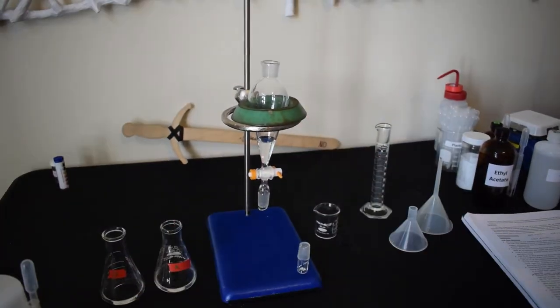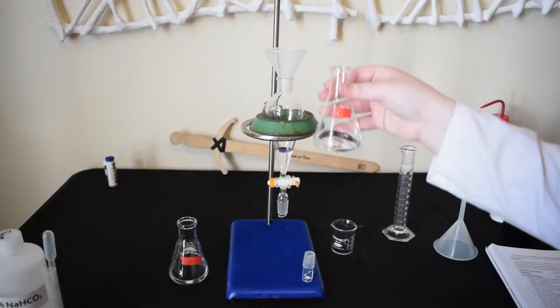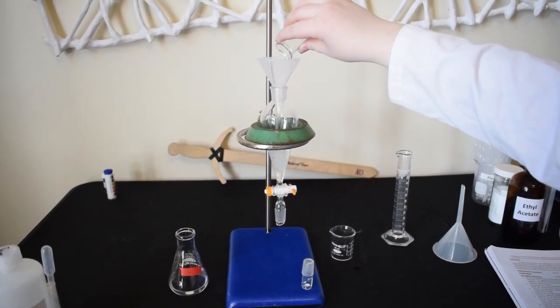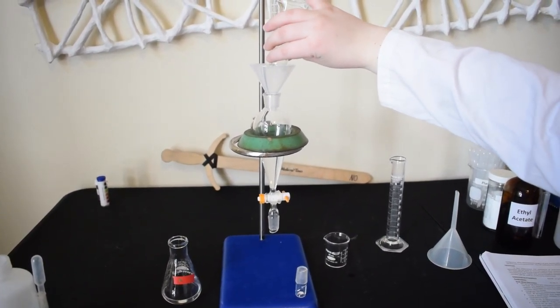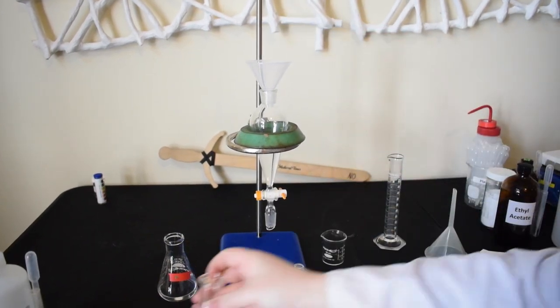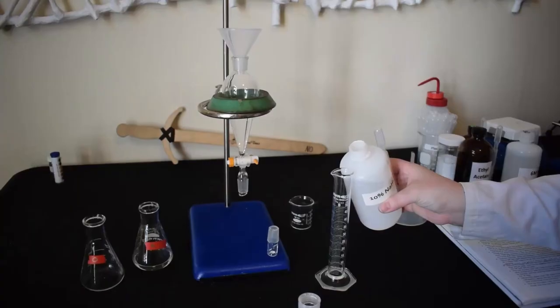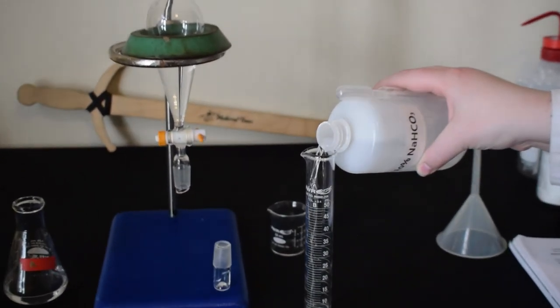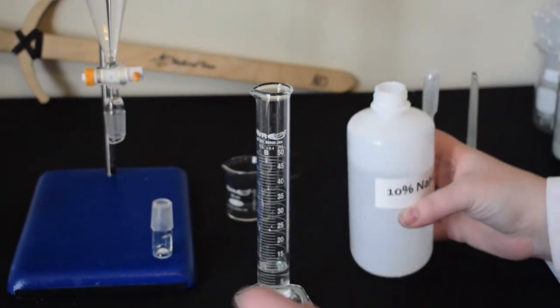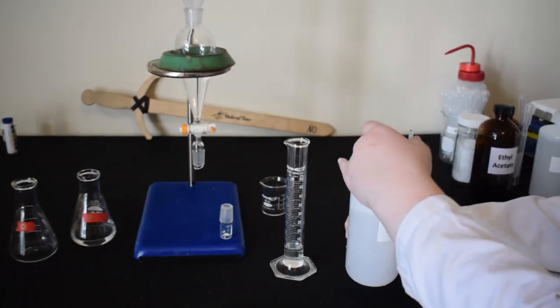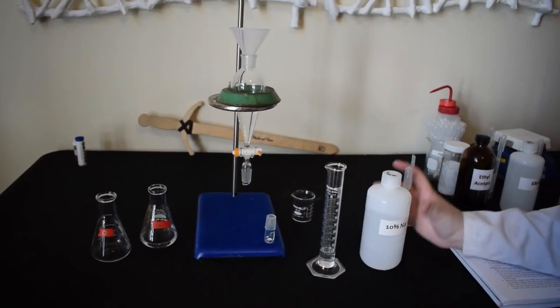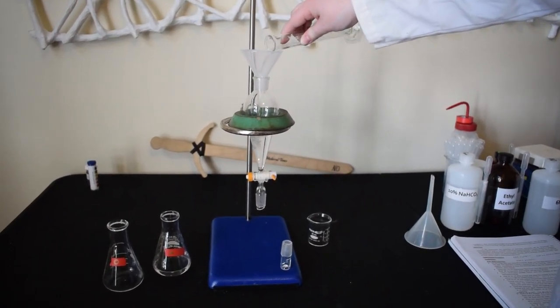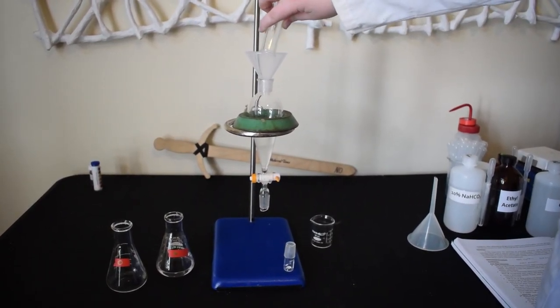Now we are going to leave that second organic layer that we've just made in the separatory funnel while we add our original organic layer back into the separatory funnel as well. We are then going to add 10 more milliliters of sodium bicarbonate into the separatory funnel. The purpose of this second sodium bicarbonate wash on the organic layer is to remove any residual aspirin that may still be trapped in with the acetaminophen.